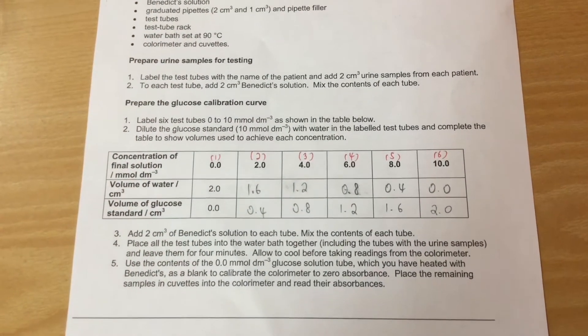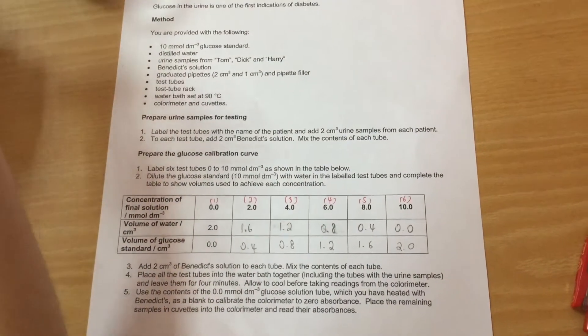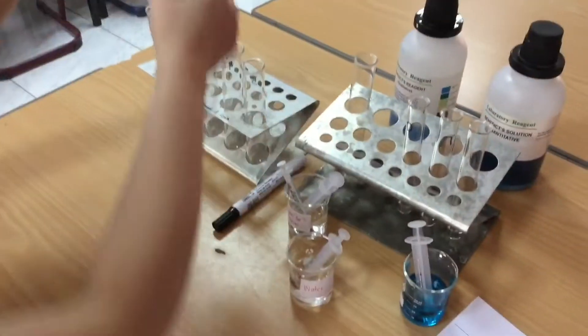So here I get organized. I've got my Benedict's ready, I've got my glucose and I've got my water and these are the concentrations I'm going to make.